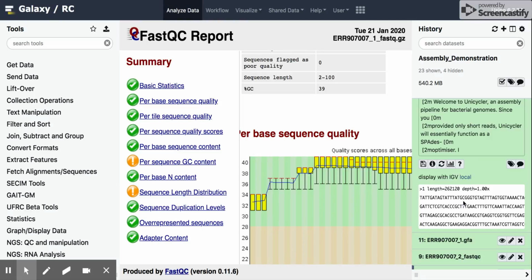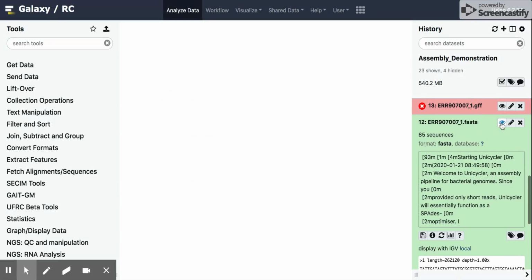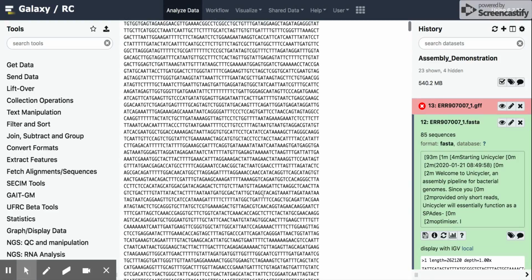So this one's actually small enough where we can look at the data and see what the FASTA file looks like. If we click this eye arrow, we'll see the output from what SPAdes is. Here we have this arrow designating the start of a read. Read 1, the length of it, so this is 262,000 bases at a depth of 1x.